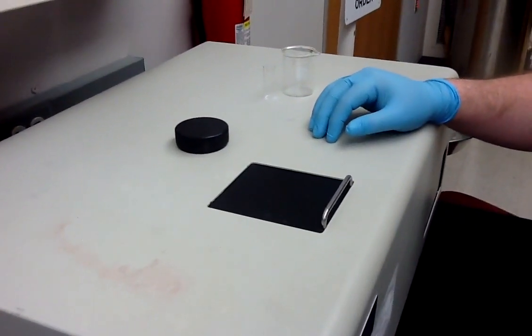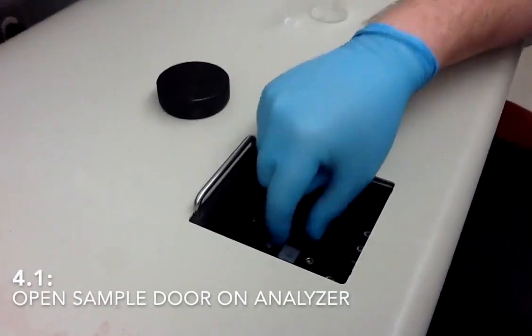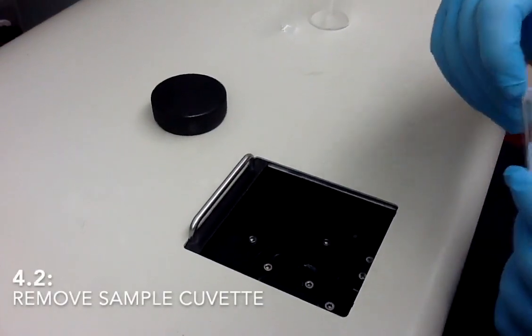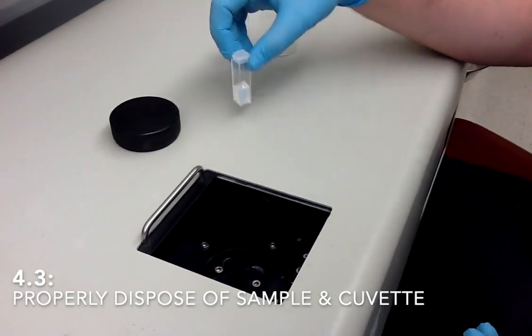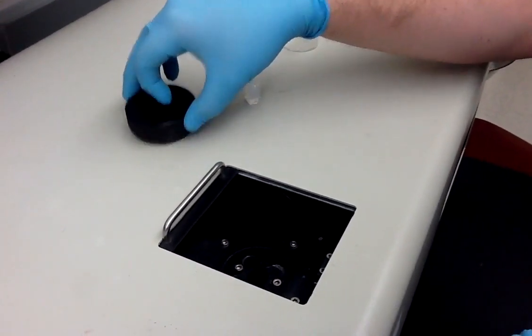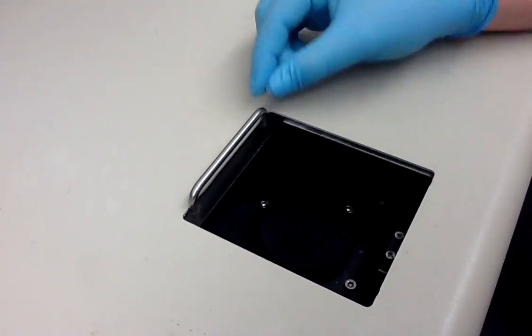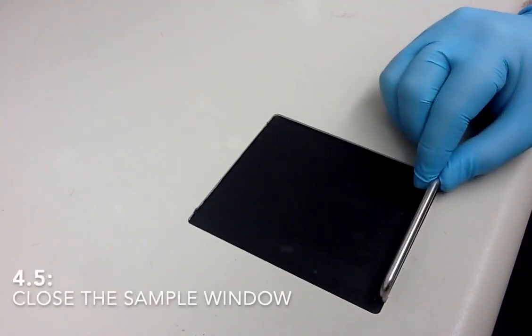Once you're done with the sample and you close the program, then you need to clean up your sample, so you can open the sample door again, pull out the sample. If you are disposing of the sample, then properly dispose of it. Otherwise, the next step is to put your sample cover back in so that no dust gets into the sample cell. And then close the sample window.